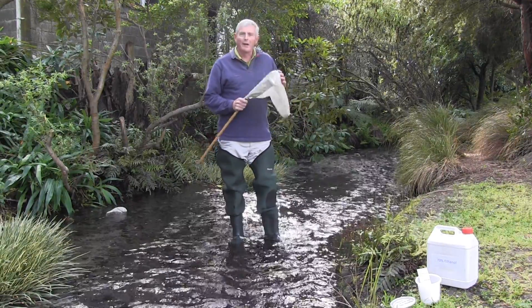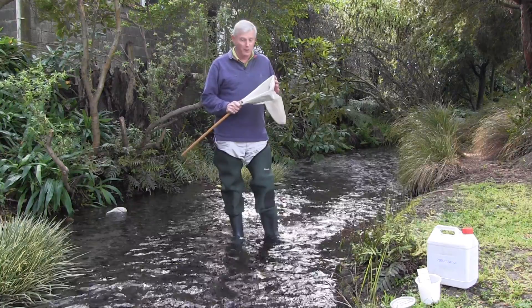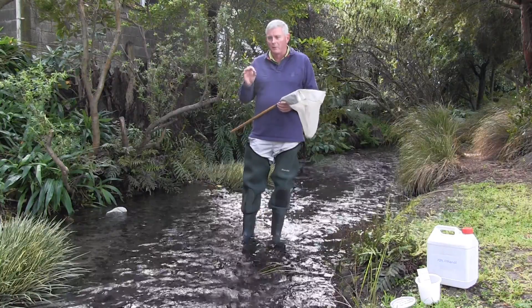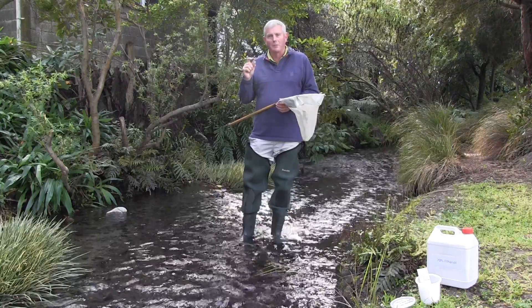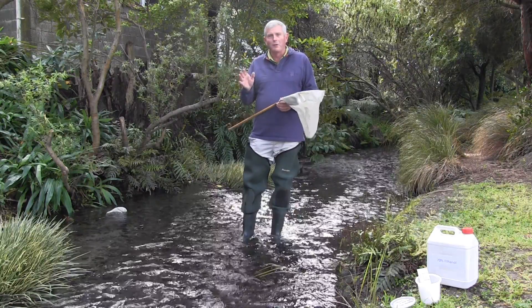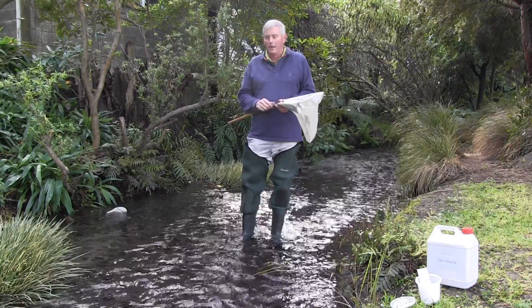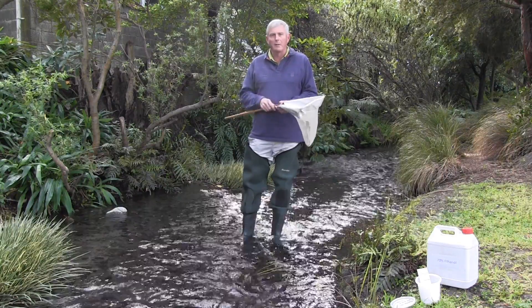Good morning, my name is John Harding and I'm going to talk to you today about taking a sample of benthic invertebrates in a stream system. One of the reasons why we're interested in this is that we want to collect these small invertebrates or insects — animals that don't have a backbone. Invertebrates are really important because they're used for biomonitoring purposes; they tell us something about how healthy or how polluted the stream is. So often around New Zealand we collect benthic invertebrates on a regular basis.